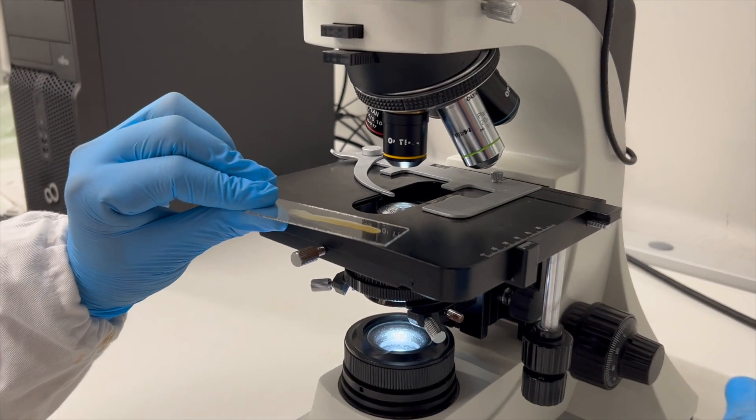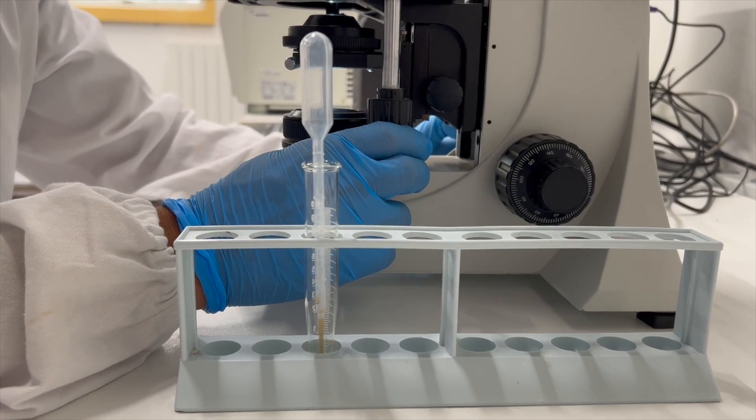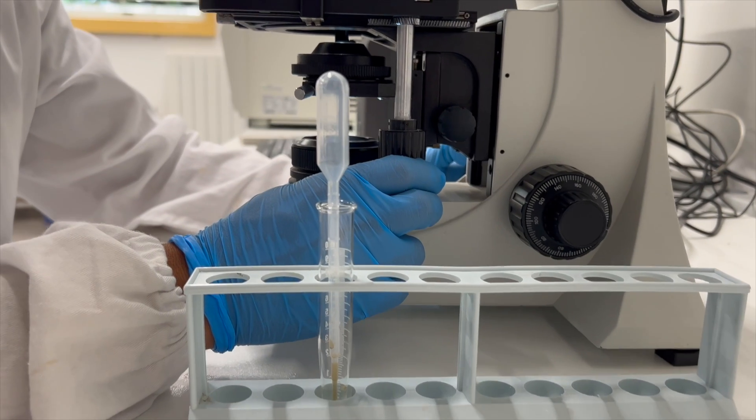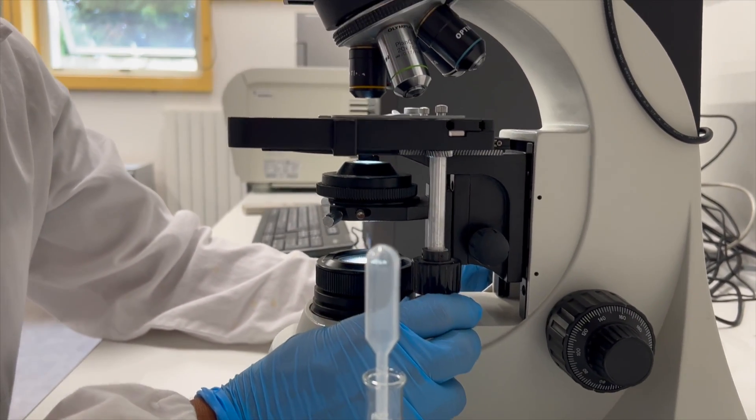Begin examining the slide at a low magnification, the 10x objective, and if larvae are found, examine at a higher magnification, up to the 40x objective, to identify characteristic features and take accurate measurements of the larvae for further identification. Thank you for taking time to learn how to perform the Baermann technique.